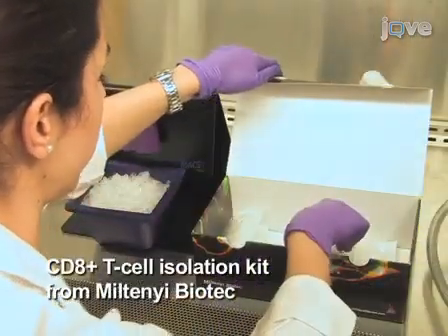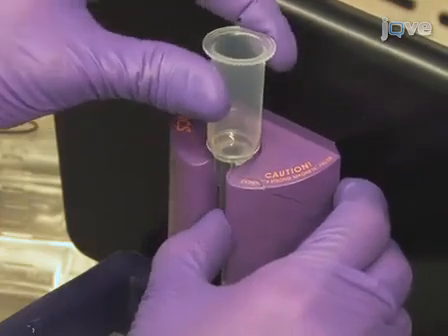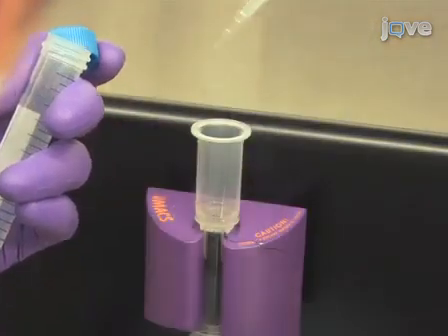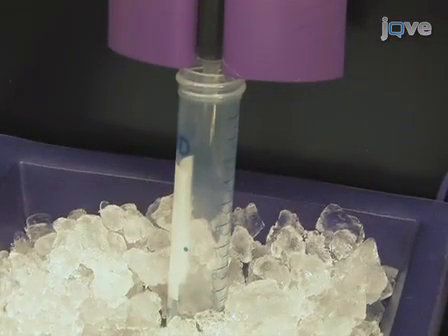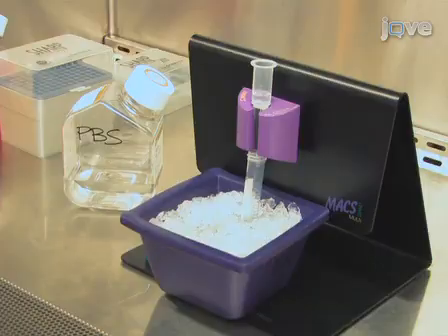Magnetically label the spleen cells according to the product manual. Place an LS column in the magnetic field. Apply labeled cell suspension onto the column. Collect flow-through of enriched mouse CD8 plus T cells. Wash the column 3 times with 3 milliliters of buffer and combine with the previous flow-through.